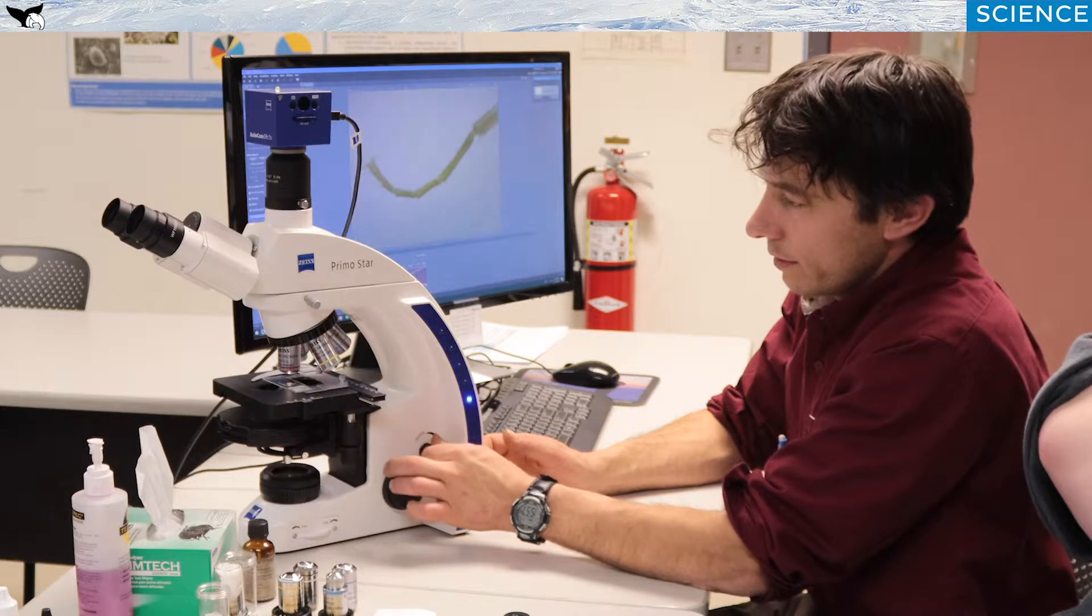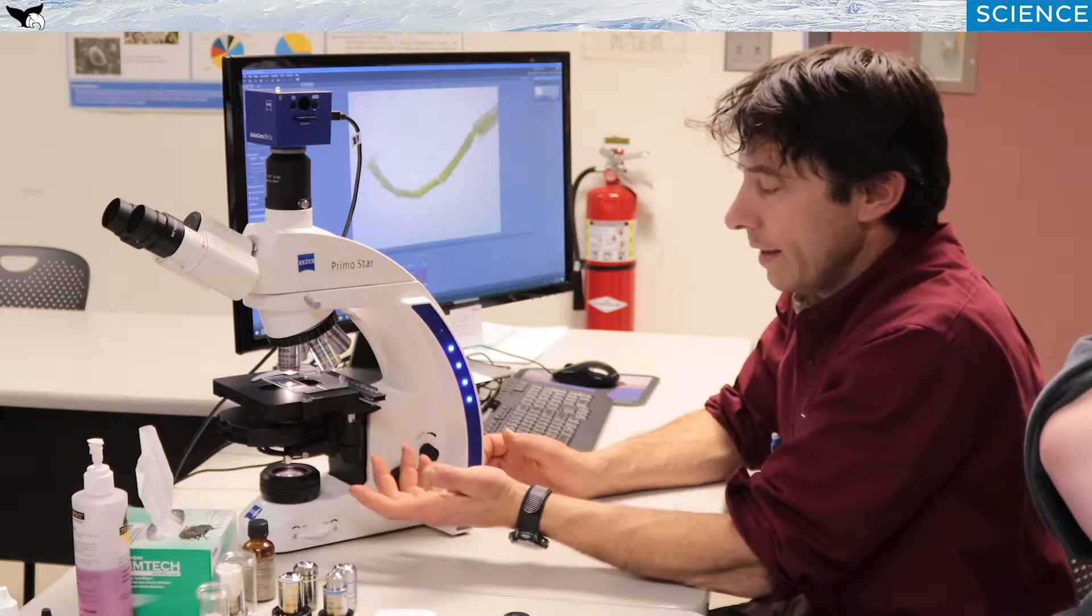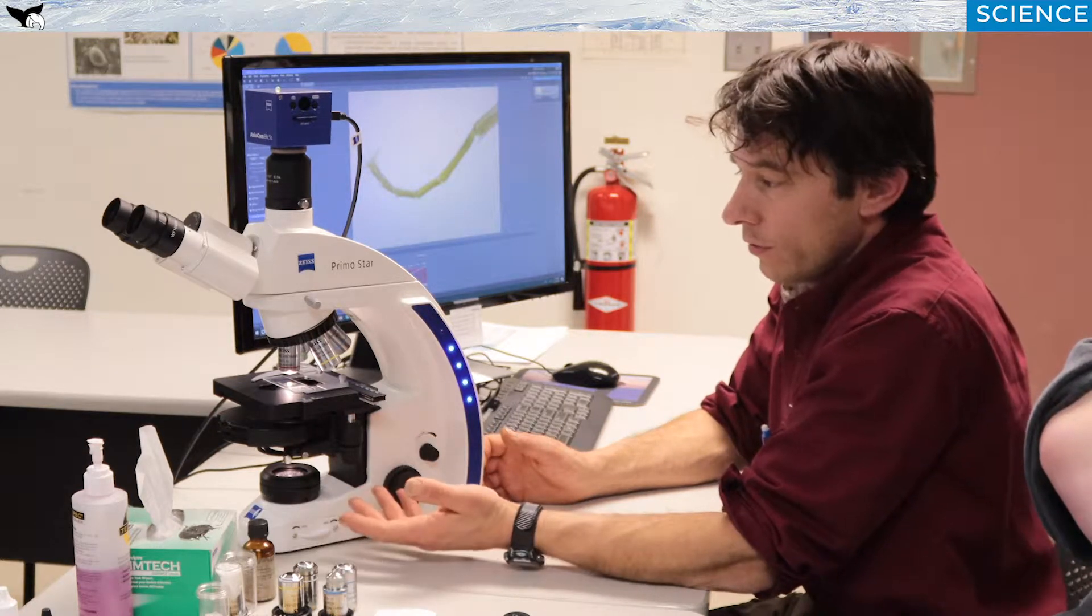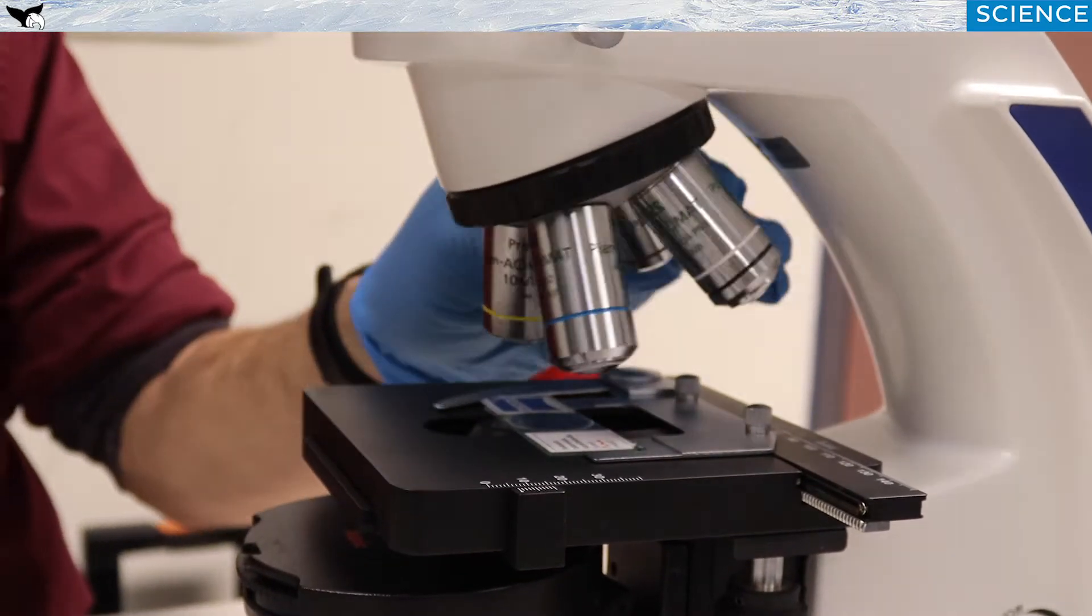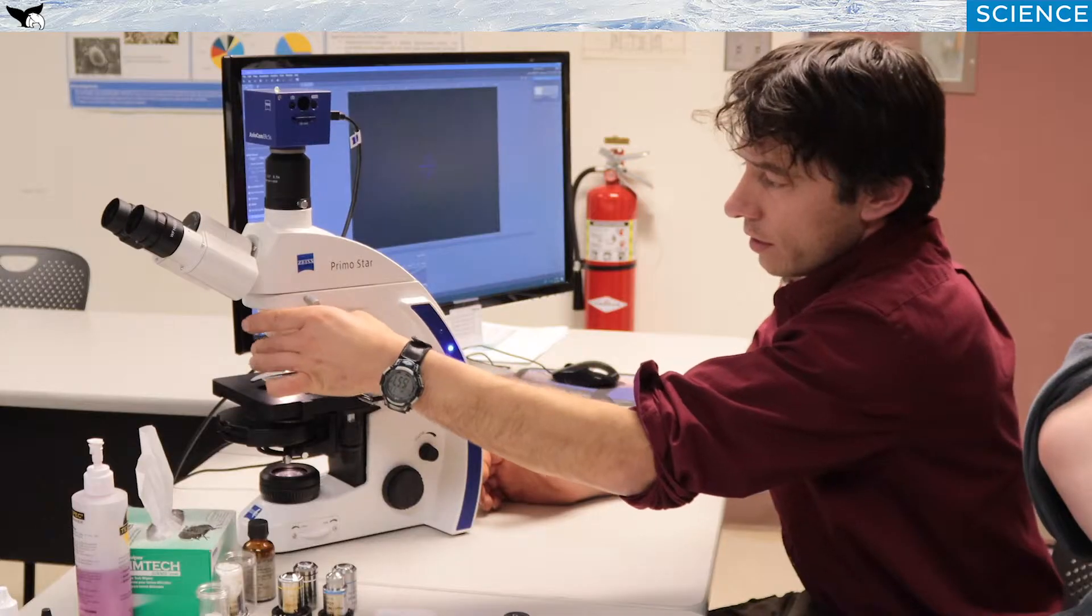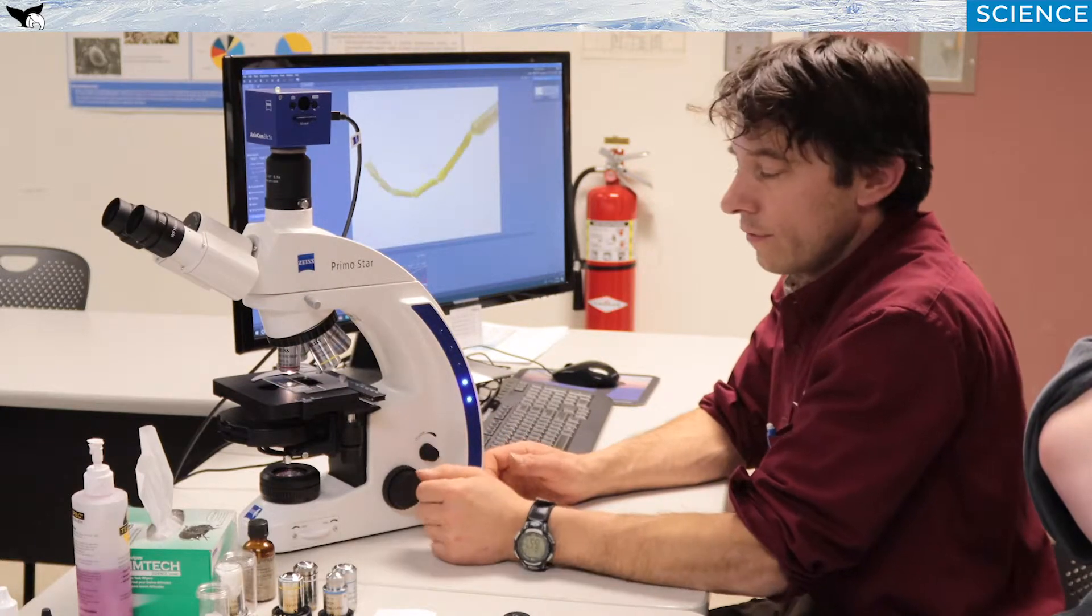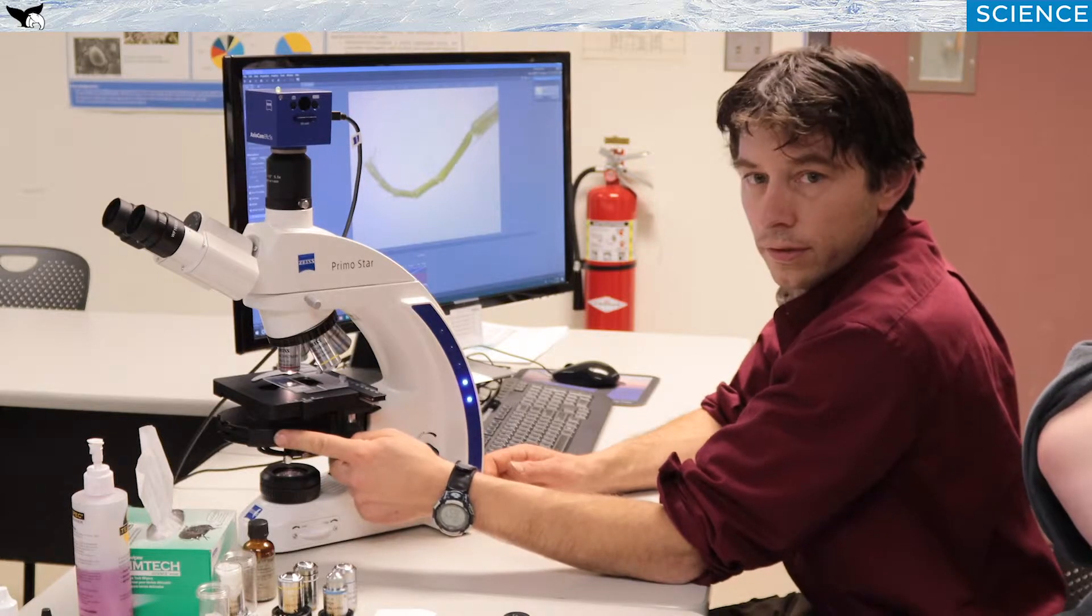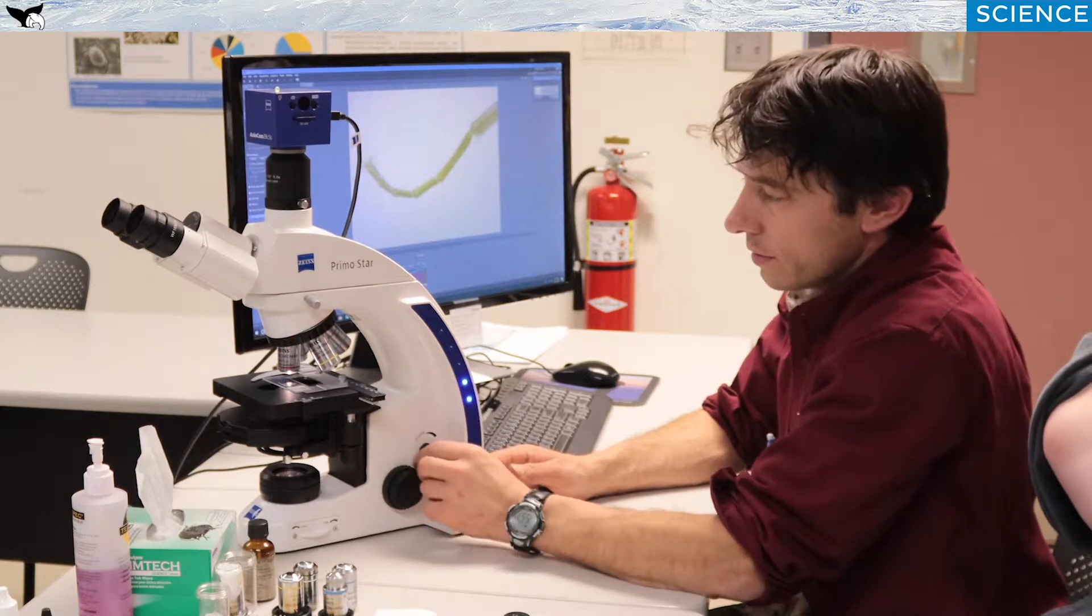But as you can see, the intensity will increase or decrease. And that's important depending upon the type of specimen you're using, and how opaque it is or not, and also which magnification you're using. As you go higher in magnification, you're going to need more light. And also, as I'll explain later, there are different contrast techniques like this one has dark field and phase contrast, which need more light, just as a basic principle.